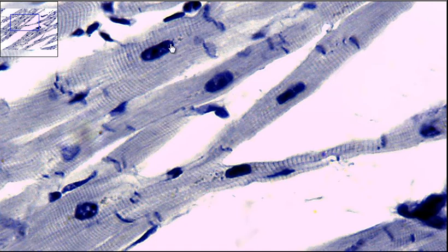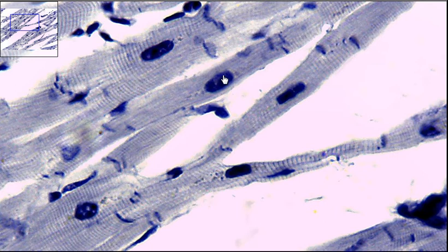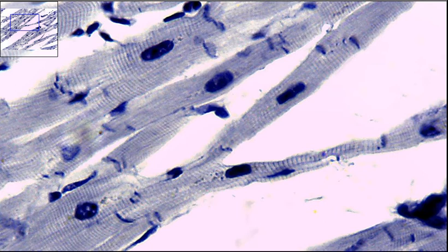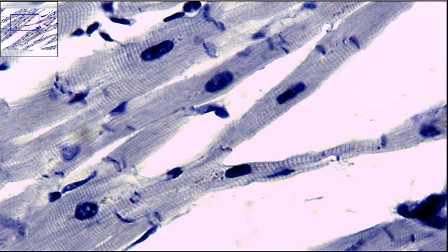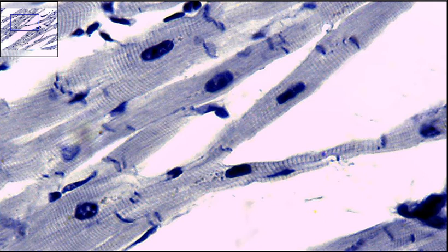We also have the nuclei here. The nuclei in cardiac muscle is a lot of times uninucleate, but it can be binucleate sometimes. So we have striations, we have this uninucleate.